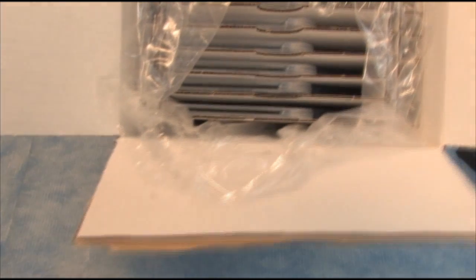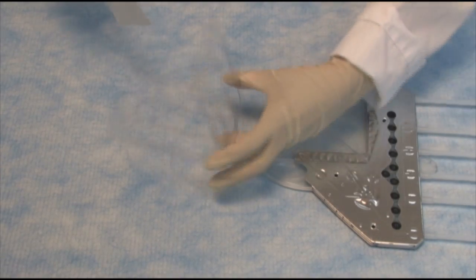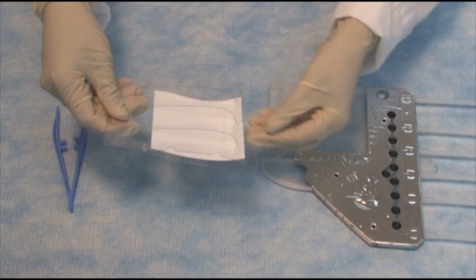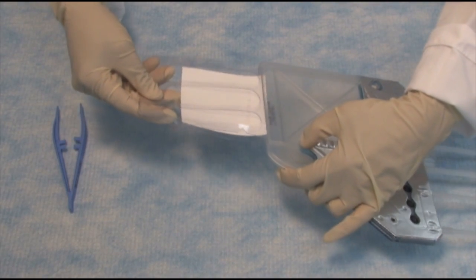Today we're going to unbox the Bench Pro 4100 Western Processing Cards. We get 10 cards. Let's begin by placing the blot in the holder, like that. Then the holder will go inside the card, and now it's ready to go inside the Bench Pro 4100 Western Processing Station.